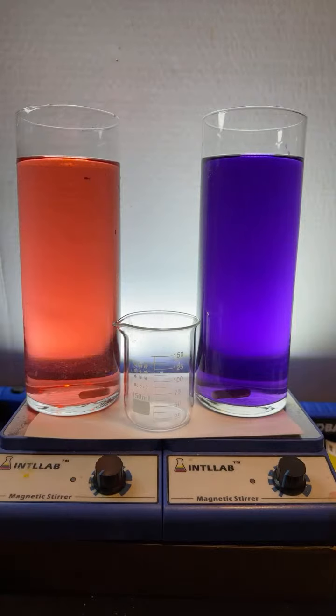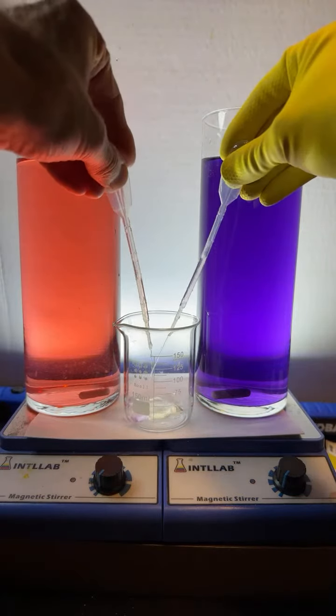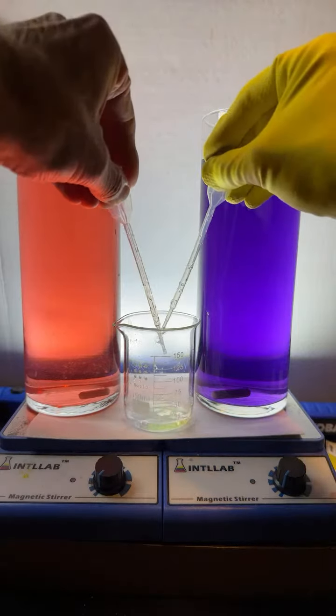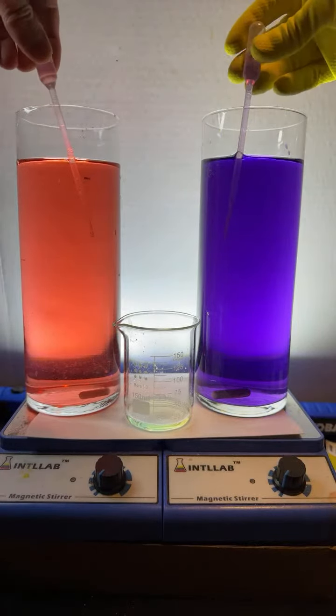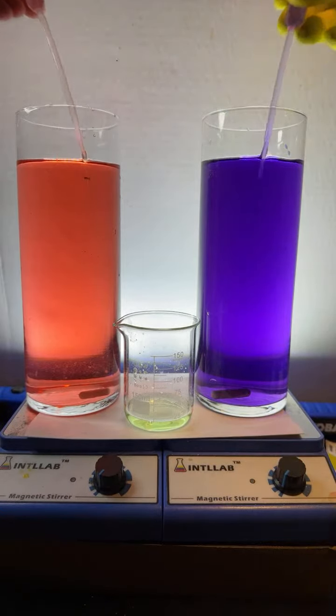Okay, so somebody asked what happens when we mix these. Let's find out. Give me a second. Here. I'm going to try to make this as even as I can. All right? So here we go. I'm trying not to make a mess. Squirting them together. So I'm just taking a little out of both, and we're going to squirt them both in there. I don't know if you can see the color yet. I'm going to do it like 4 or 5 times.